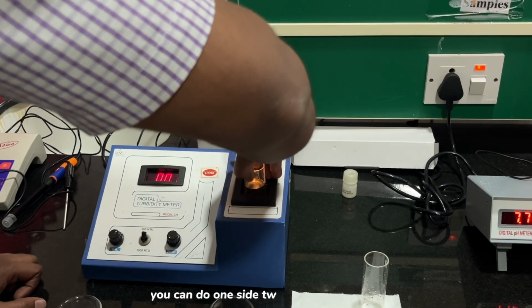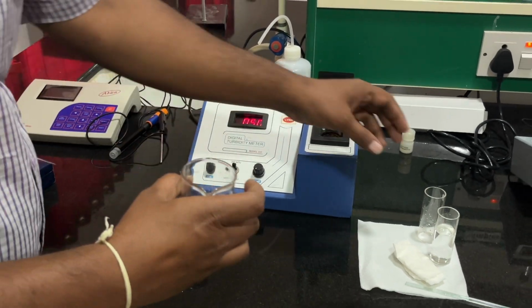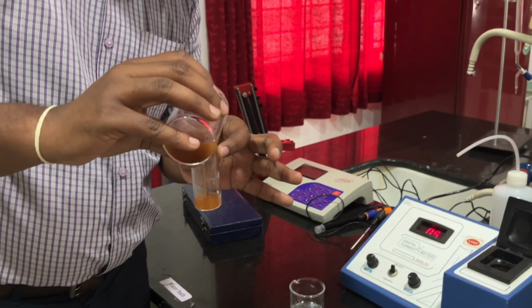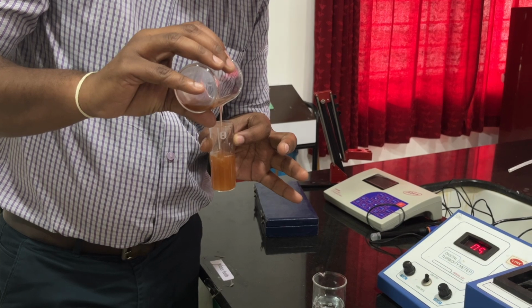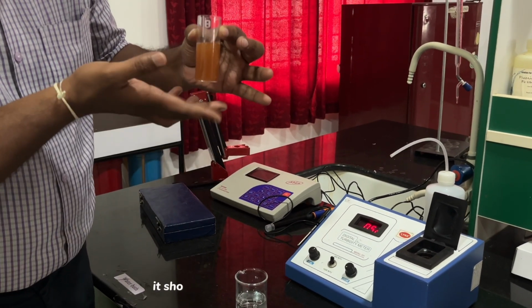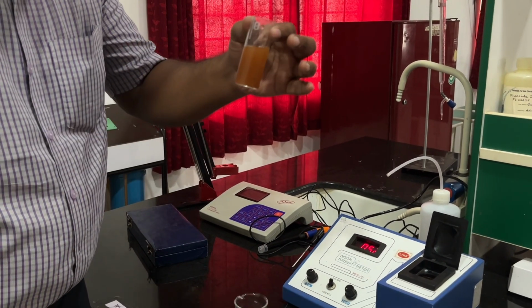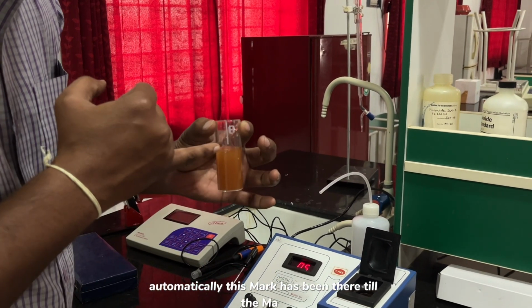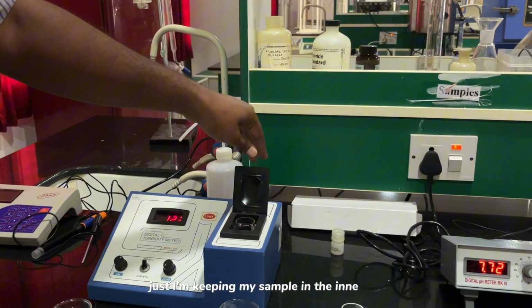You can do this calibration once or twice, and next you can take your turbidity sample, the sample we have to identify. Let me take some sample and pour it in. There should not be any bubbles, so let us shake it a little so that the bubbles are released. The water has now been filled up to the mark. Just I am keeping my sample in the turbidity meter.